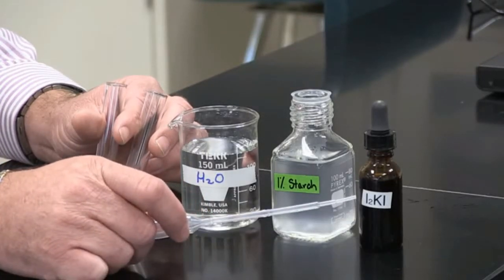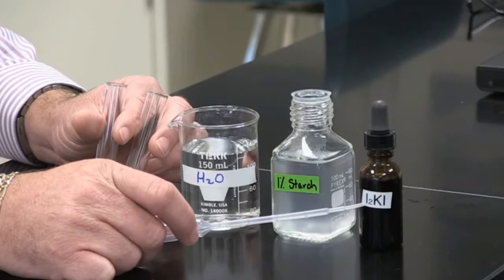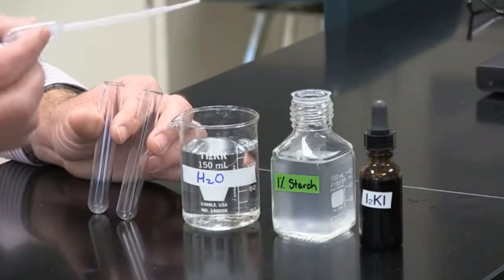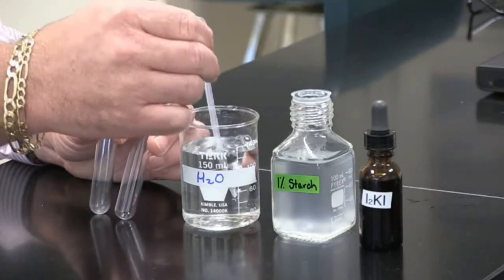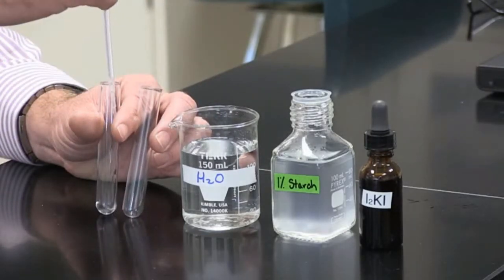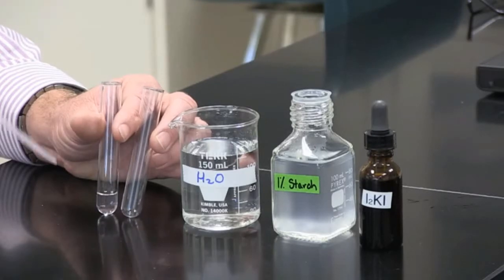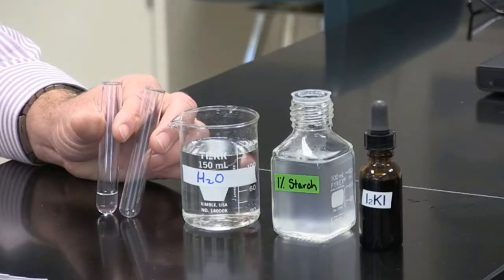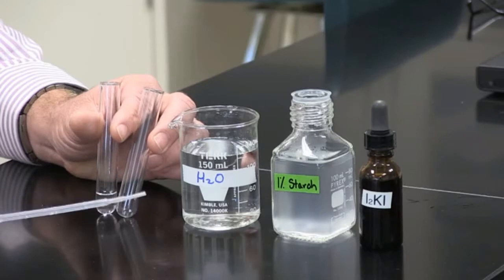So we're going to do the demonstration by putting in some water in one test tube. That's just plain water out of the tap. And then we're going to put some starch solution in the other test tube.